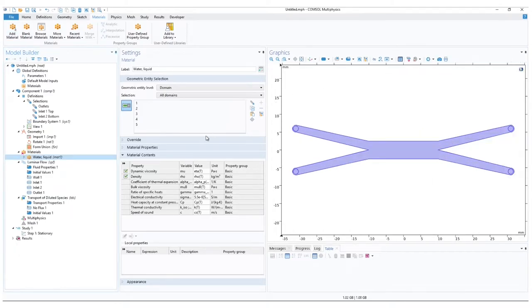If we look into the settings of the material, we can see all the parameters that it comes with in COMSOL. In some materials, even the built-in option has some gaps, depending on the physics you've chosen to simulate them in. But no worries, all necessary missing parameters will be shown here and are left for you to look up or calculate. In the geometric entity selection, as with the used physics, make sure the domain selection covers only the necessary parts. Firstly, clear the selection and choose the main channel. For this simulation, we will only use water to view the mixing effect of its different molecular concentrations.